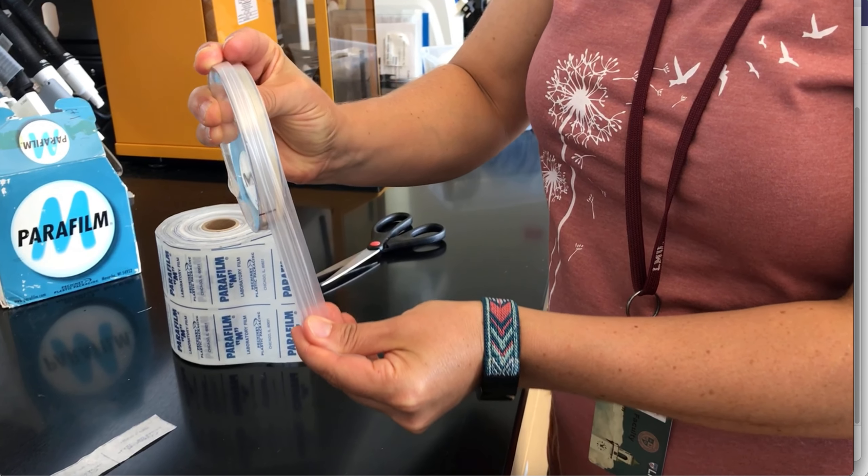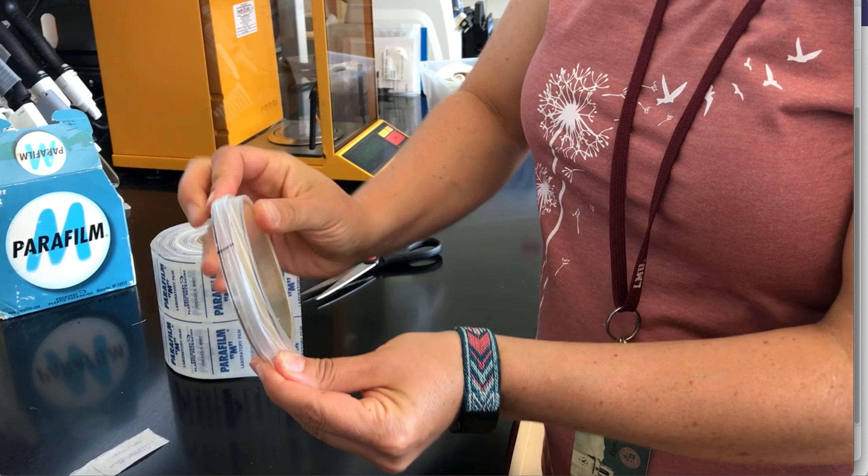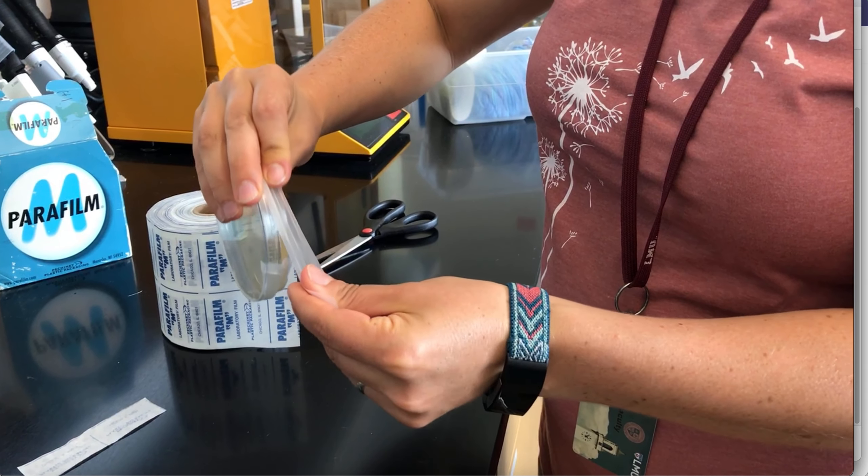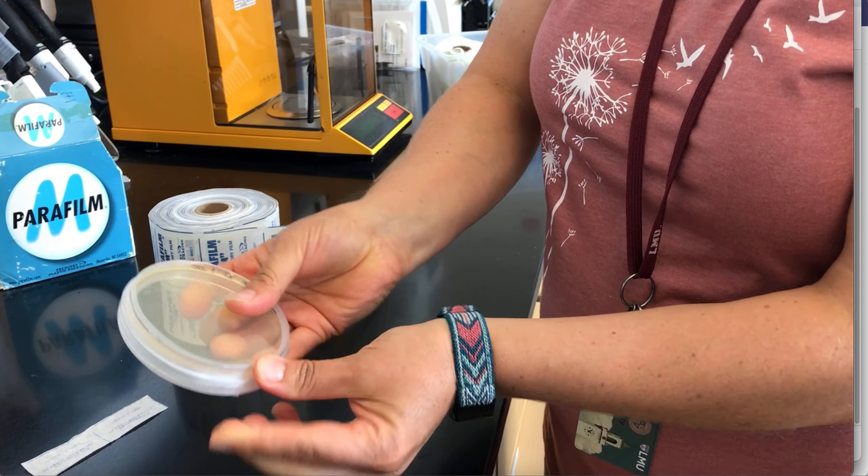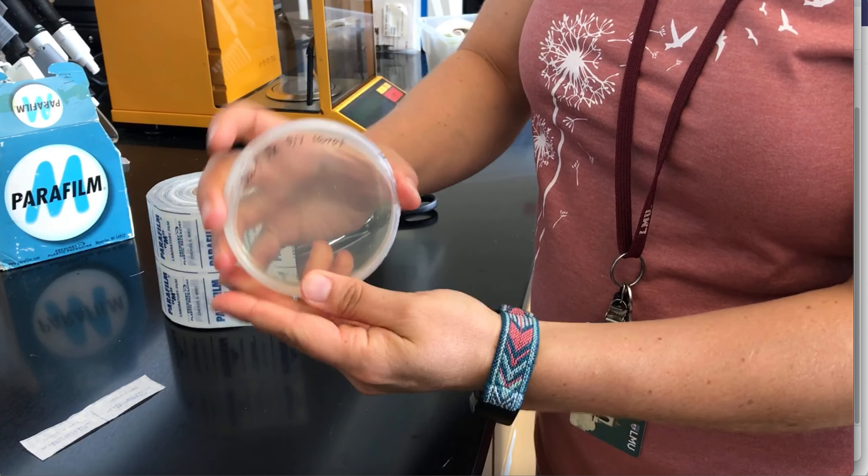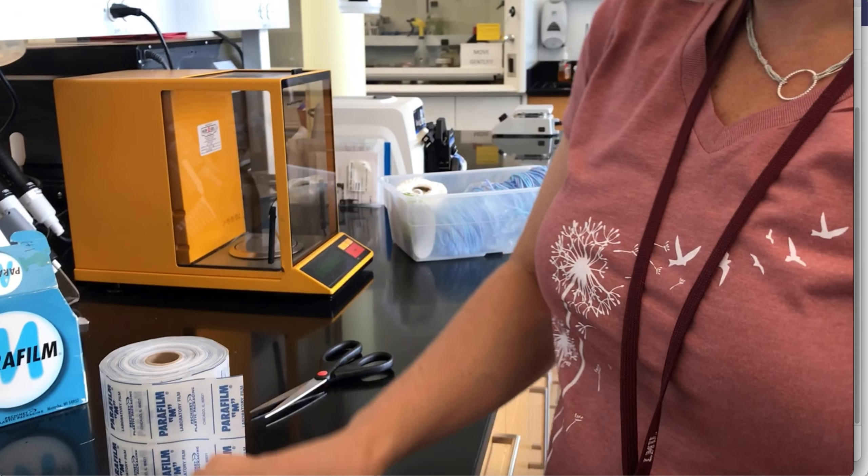Stretch it again and stick it to the plate, and you do it until you run out of parafilm. I'm left-handed so you would do the same thing in the other direction. And that's how it's supposed to look like.